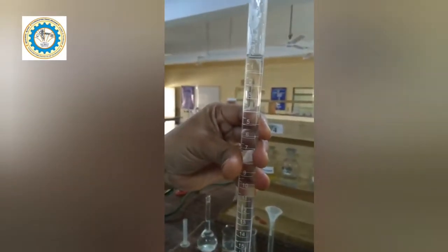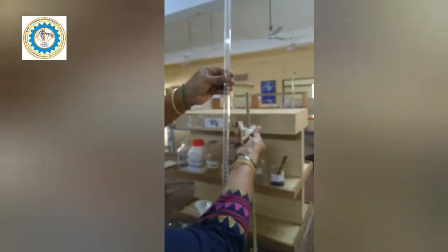Now see this — it is set to zero. I will adjust the level to zero, leave one or two drops, and set it to zero. The lower meniscus should touch the zero line. Now I am going to clamp this burette to the stand.